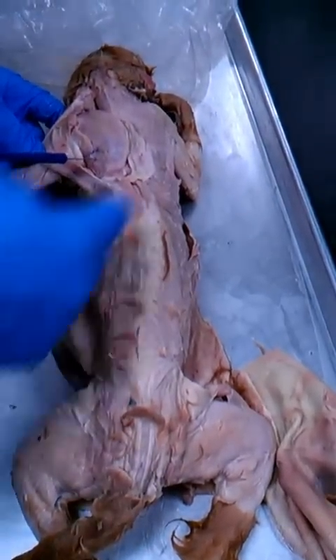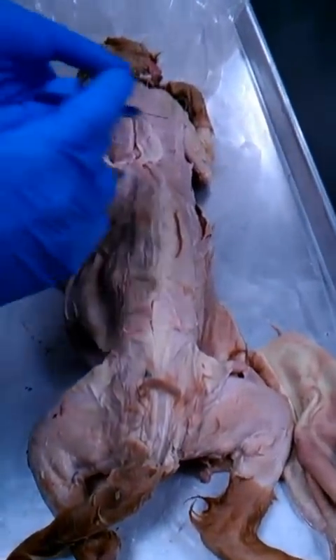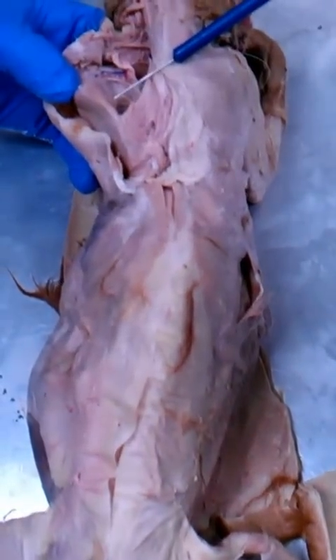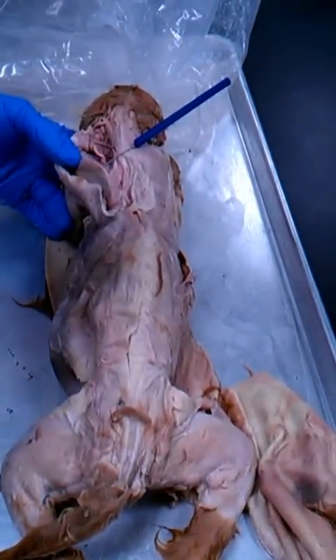The other thing we have in the scapular region is the subscapularis. Remember what the prefix sub means. It means below, deep, right? So on the deep side, here, we have the subscapularis. It's also the anterior side. Remember, you're looking at this from posterior to anterior, so deep to this side is the anterior side.